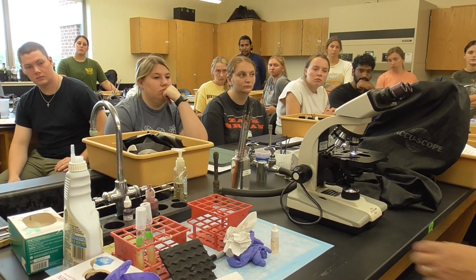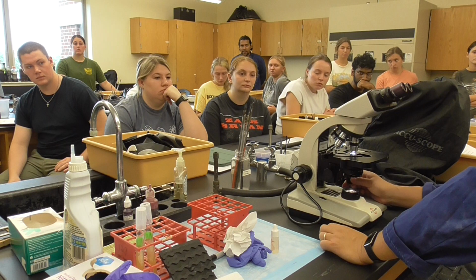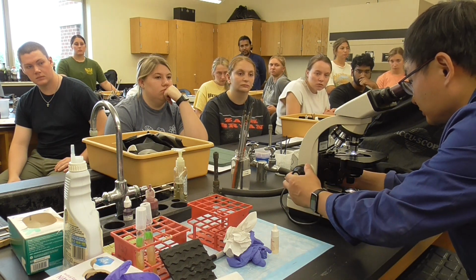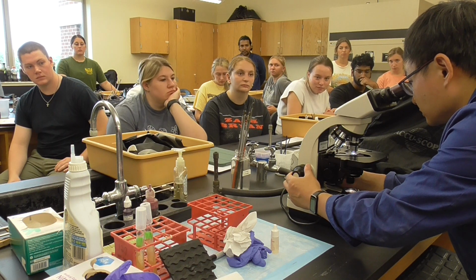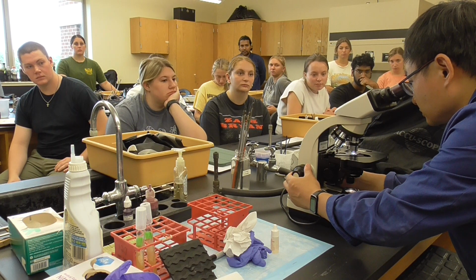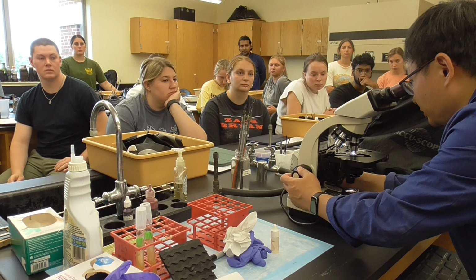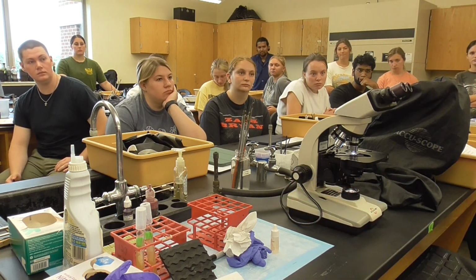Now let's just do something tricky. We're going to just move it to here. Okay, because it's called parfocal. We just move to here. We'll see whether we can find it. Okay, we still find something, but I don't think it might be lactobacillus. For me, it looks like a coccus.